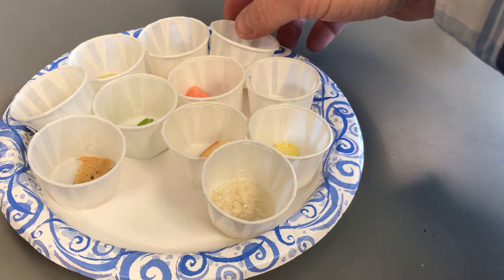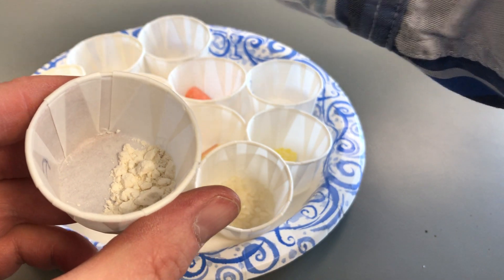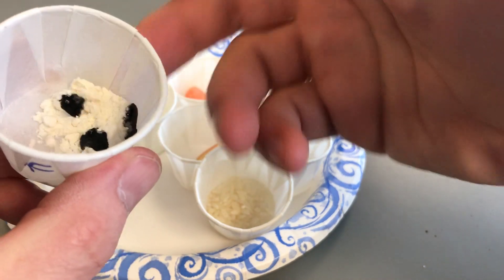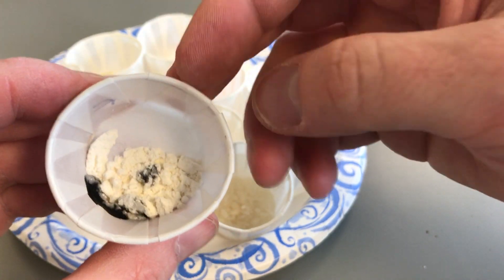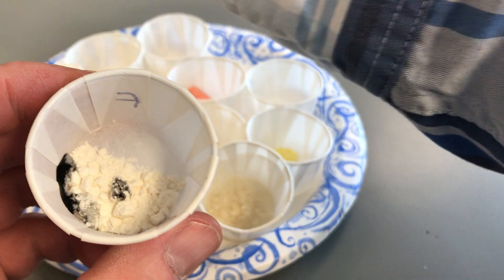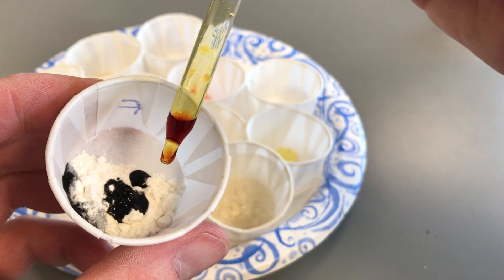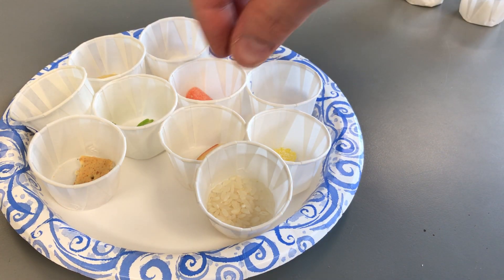Next is flour. Notice the really dark color in the flour right away. We want to focus on the material itself, not the cup — the cup may change color too. Comparing the two colors: it's not red or yellow, it's definitely black. Flour is a positive test for starch.